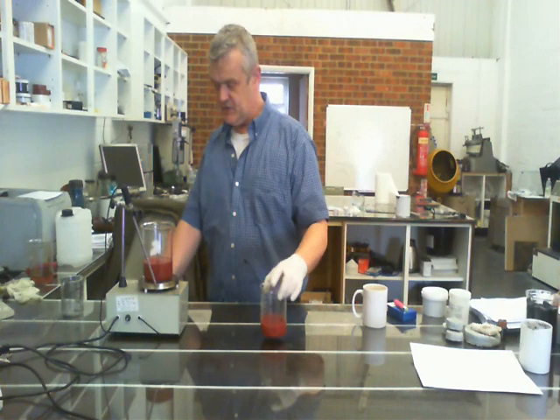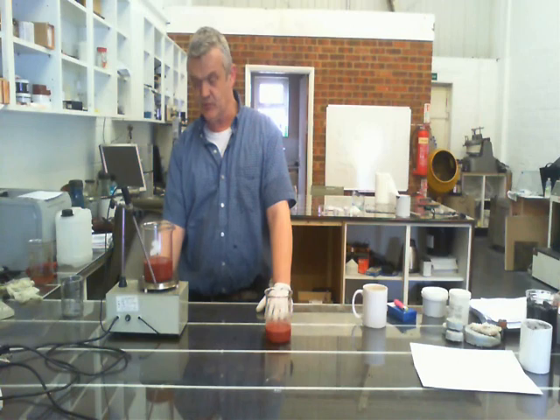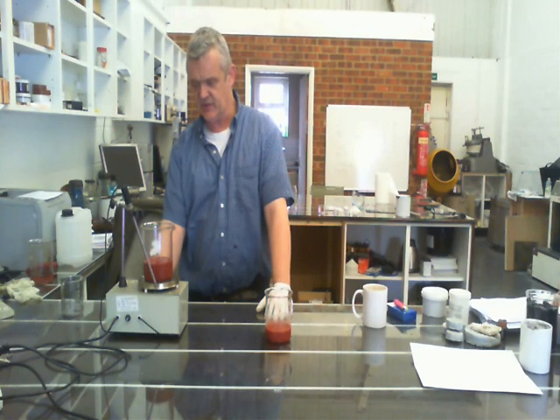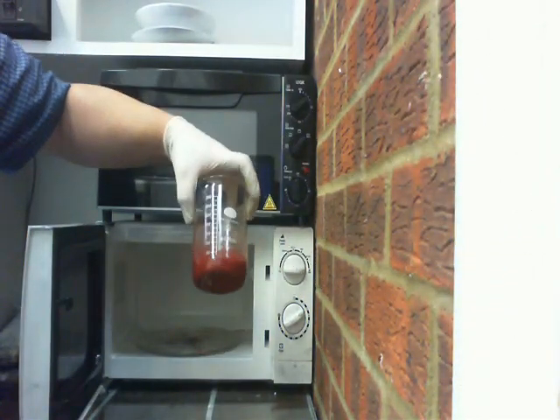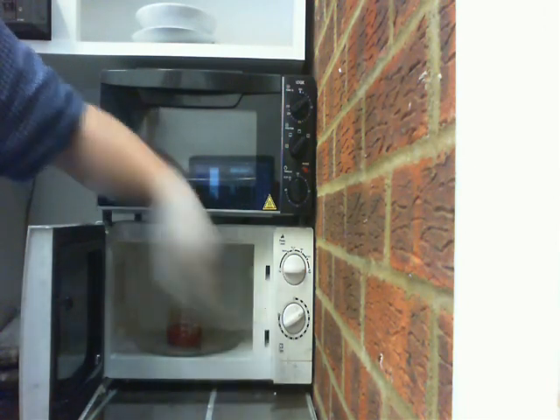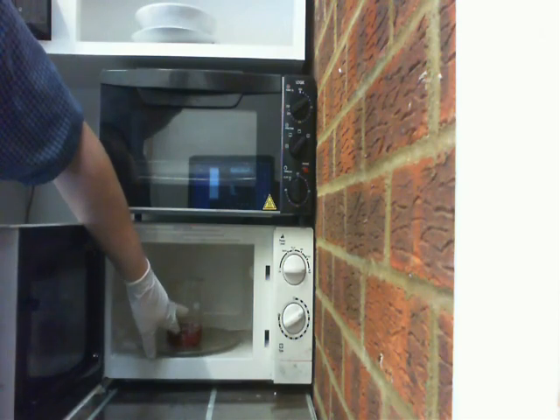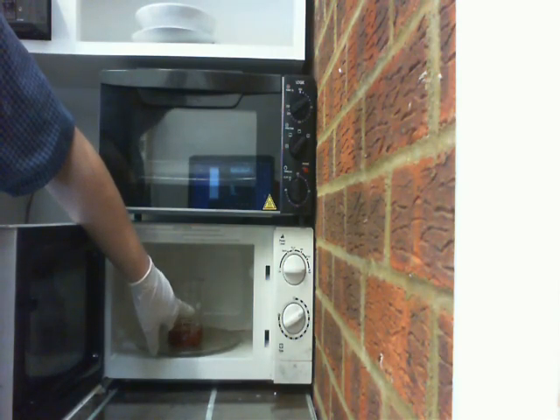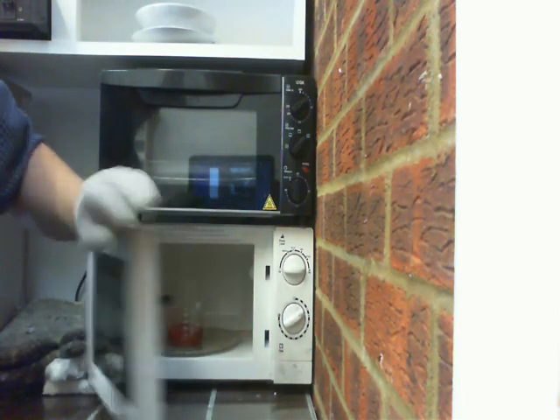I've poured off 75 millilitres for the microwave. One thing I forgot to mention: you need to change the temperature from 50 up to 90°C. Here is our copper oxide in formic acid and 10% gelatin solution. Pop it into the microwave at high for a few minutes — what you'll see is it will bubble up, but because of the gelatin in there it won't go any further, meaning we can leave it until that red turns to pink.